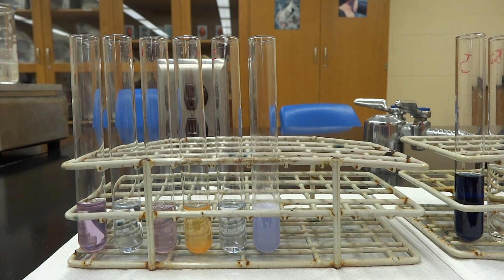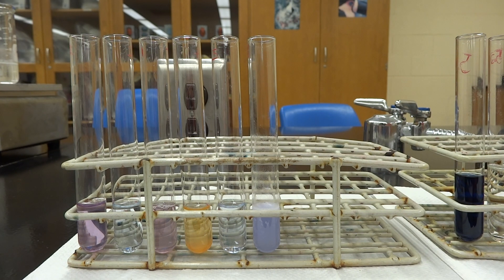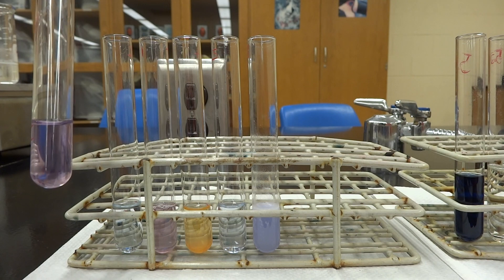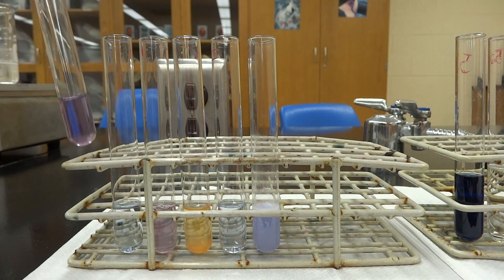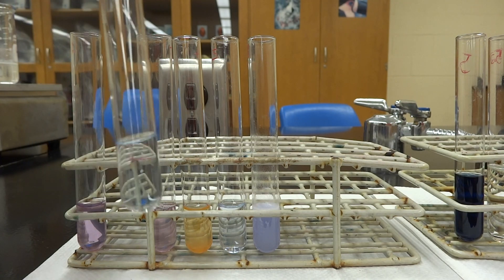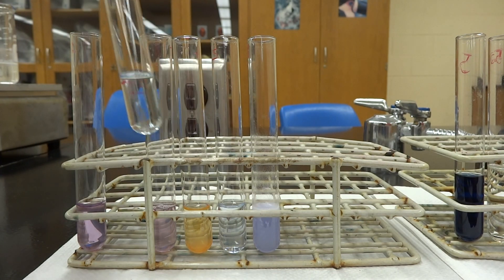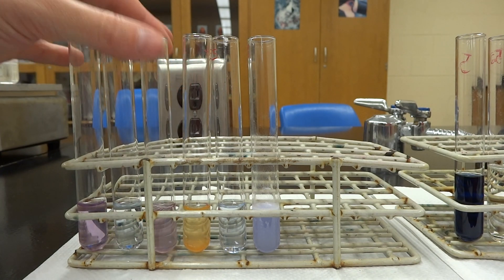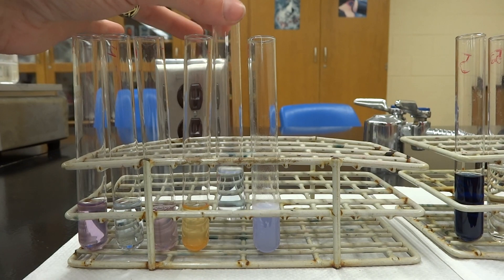Looking at the tubes here, we have positive control and negative control. Number one is just a protein solution — it turns a pinkish, purple-y color. Number two, the water, turns kind of clear-ish blue. Our unknowns for this are egg albumin, sucrose solution, amino acids, and milk.